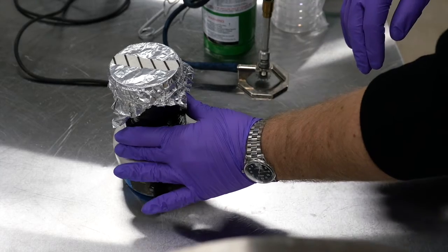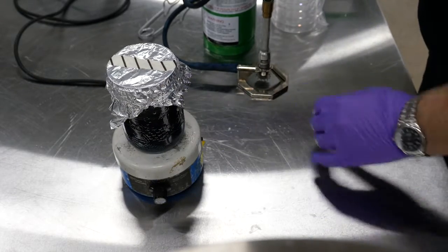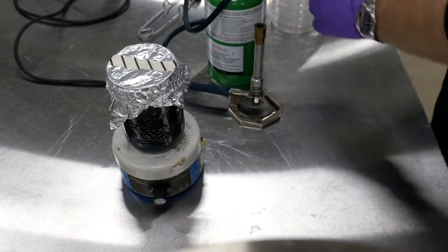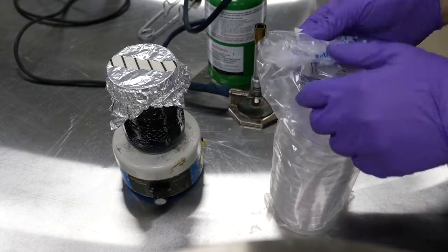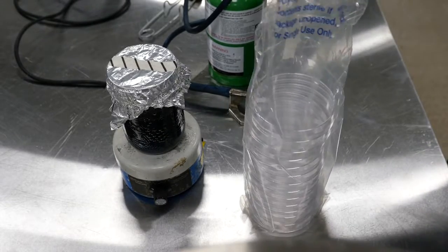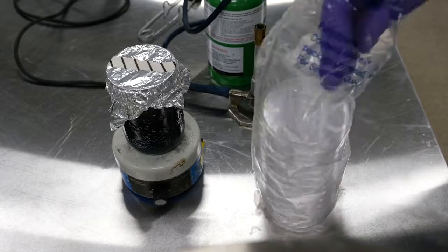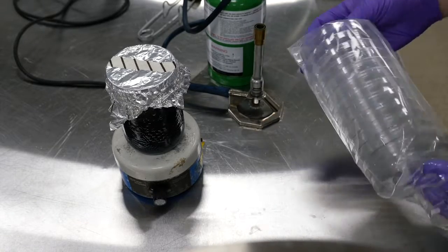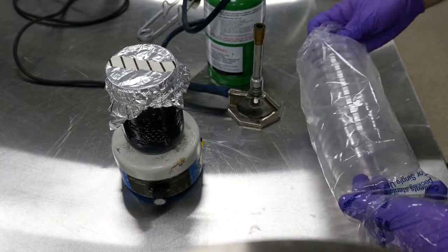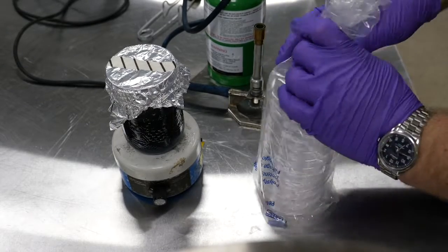So the agar is now cool enough to handle. I've got my Bunsen burner here. I've also got my petri dishes. And I've already sanitized my work area with isopropanol or any other sanitizer.